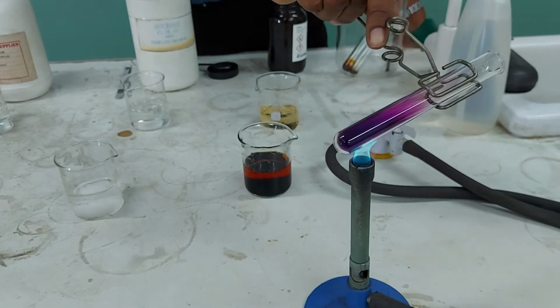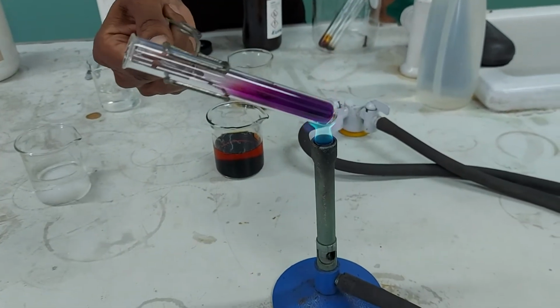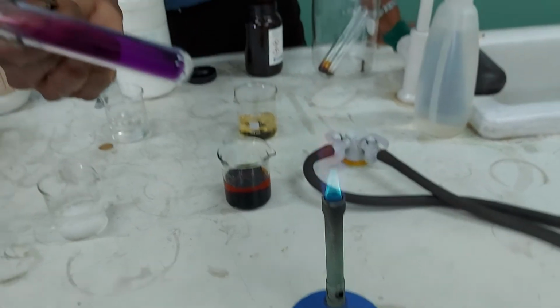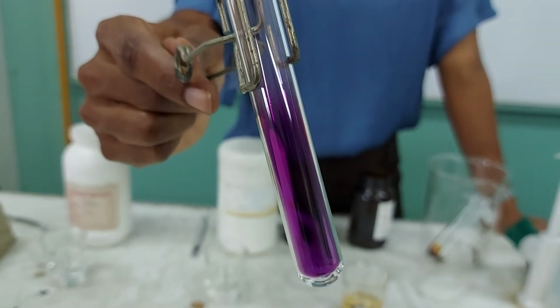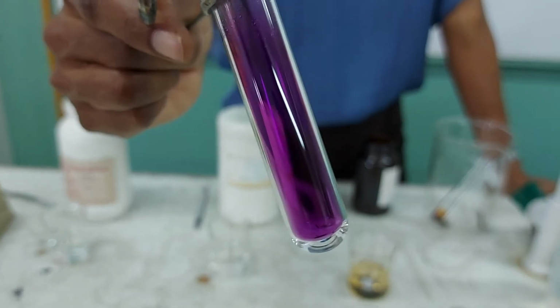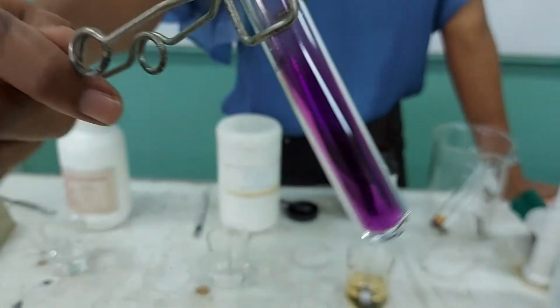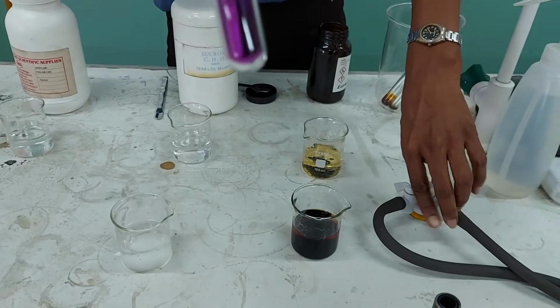I'm moving the heater to try to heat all sides of my test tube. Usually when we're doing heating experiments, we will use boiling tubes. Please make your observations at this point. What changes did you see occur with the heating of the iodine? Is it that the bottom is looking a little lighter in color compared to some areas of the top now? Those are very important indicators. So tell me, what are you observing in terms of how the substance looks? I'm going to turn off my flame now, and I'm going to proceed to another experiment.